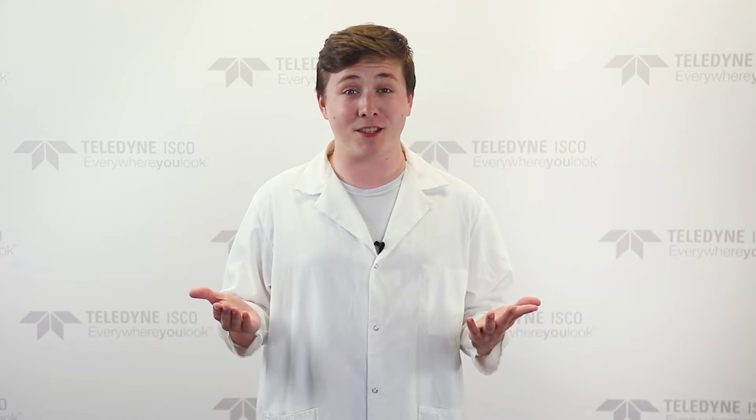Despite its popularity, TLC is often conducted incorrectly, which reduces both consistency and efficiency. We're here to explain the correct method for thin layer chromatography and provide a demonstration for you to follow along with at home. First, let's go over the materials you will need.